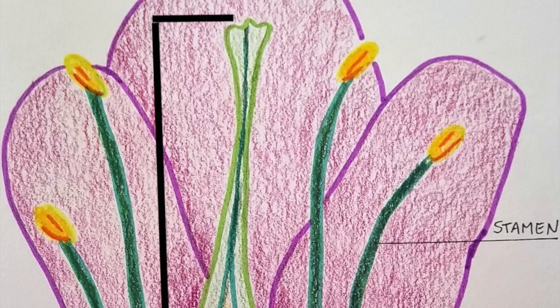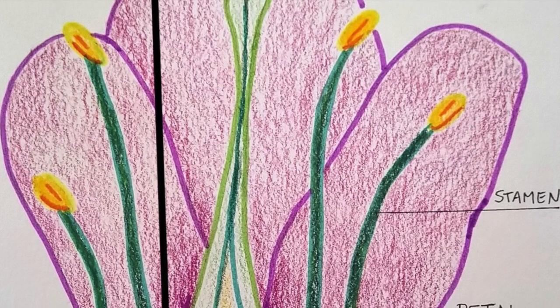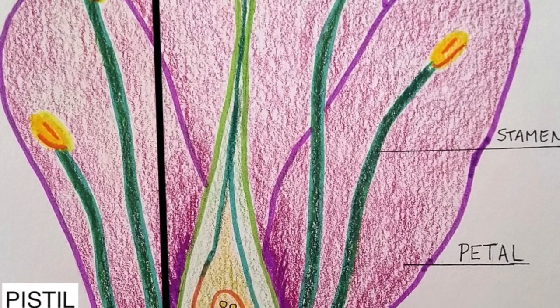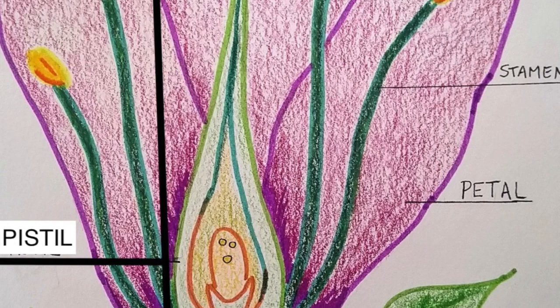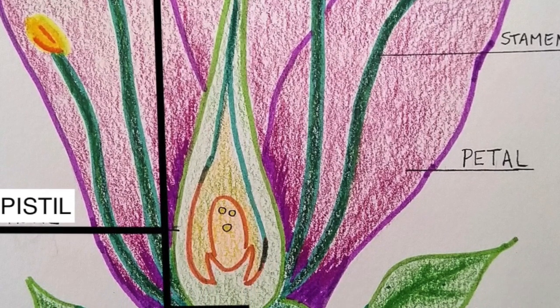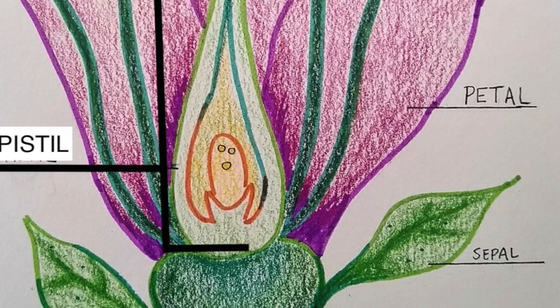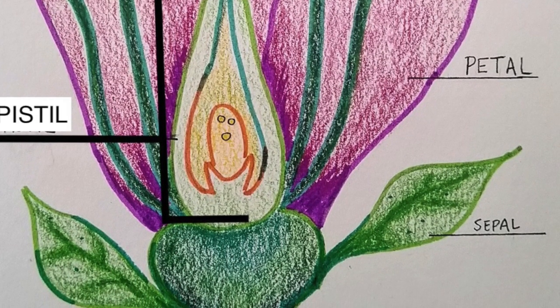Here in the middle of the flower we have what's called the pistil. And that's this long tube that goes down into this sort of sac-like thing. And in the bottom of the sac, that's where these little baby seed eggs are. And the pollen has to go all the way down that long tube, meet up with the baby seed eggs, and make new seeds so that you can plant new flowers.